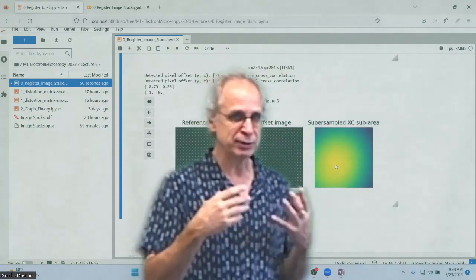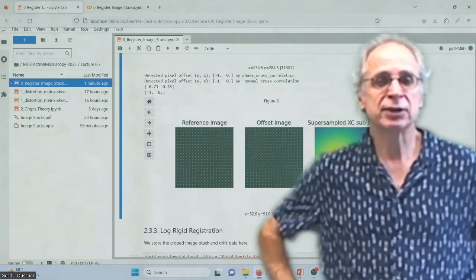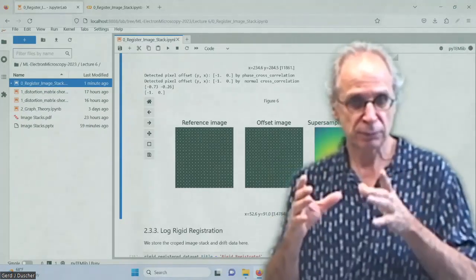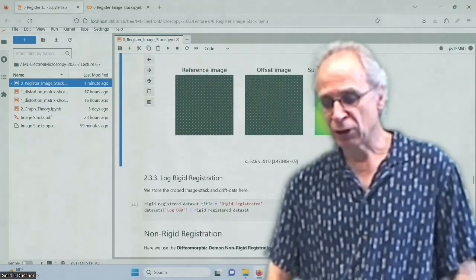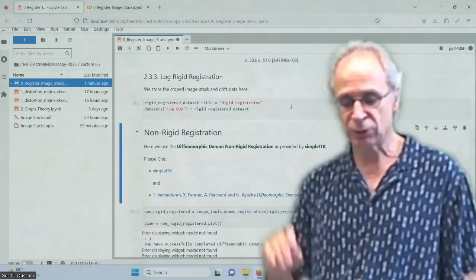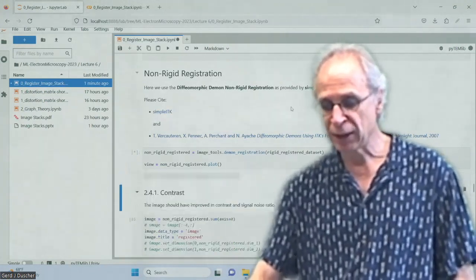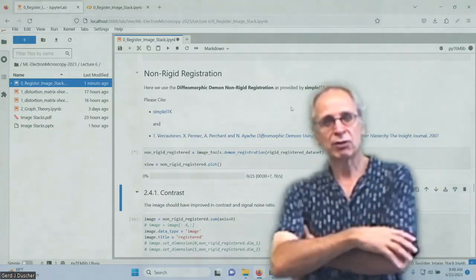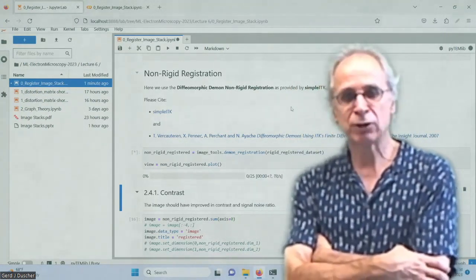Again, in order to align the images, you have to do some interpolation between the pixels, but we will do an interpolation between the pixels anyway, and it doesn't help you against the small dancing of the atoms around. So we do now a rigid registration, so we save that because we might want to use that again. So now we do a non-rigid registration. That will take a while. This is a so-called demon registration. Let's see how fast it is on my computer.